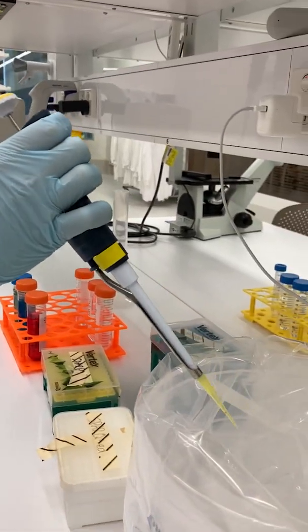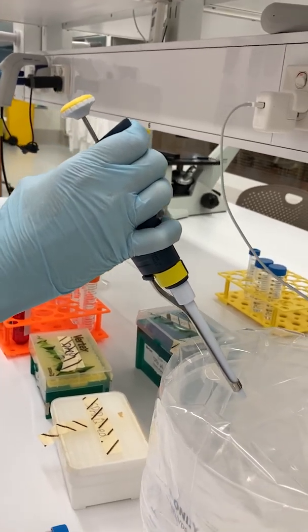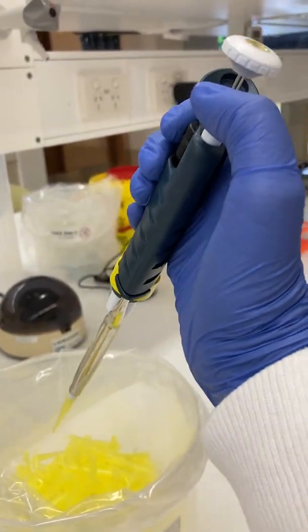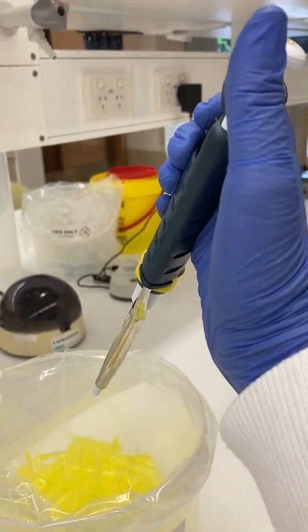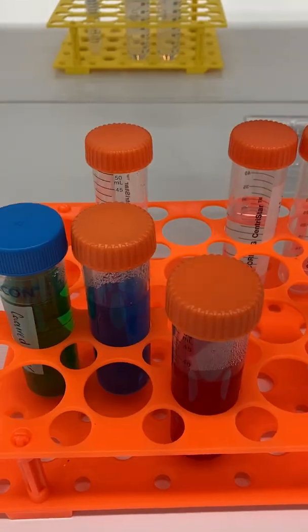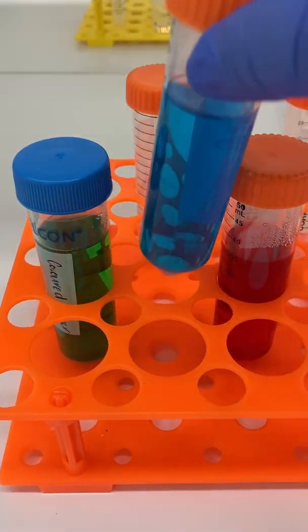You must change tips between liquids and if it has touched any part of the container. To eject the tip, hold the pipette over a waste bucket and press the small ejector button on the side of the body. Repeat this process for each liquid you need to dispense.